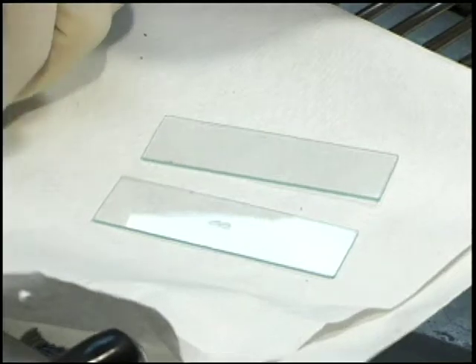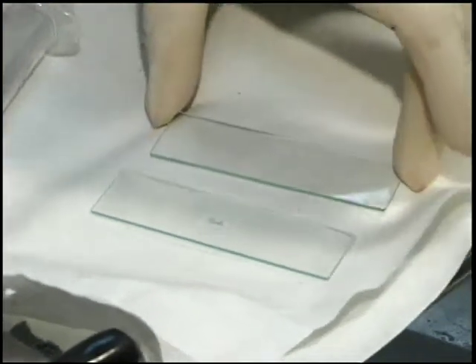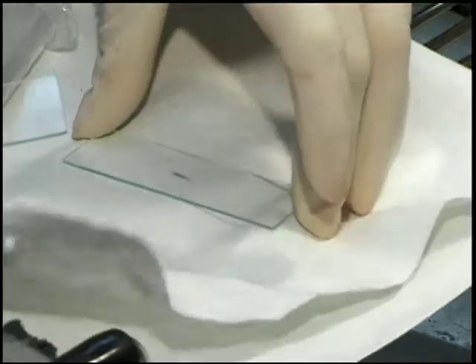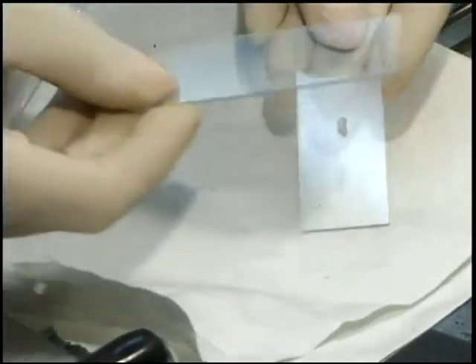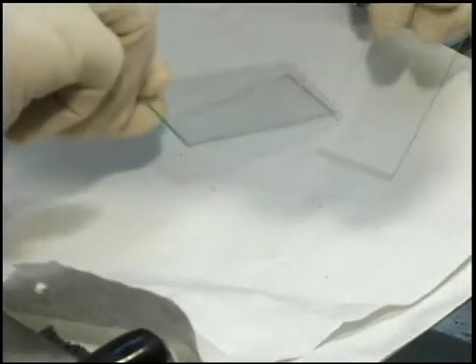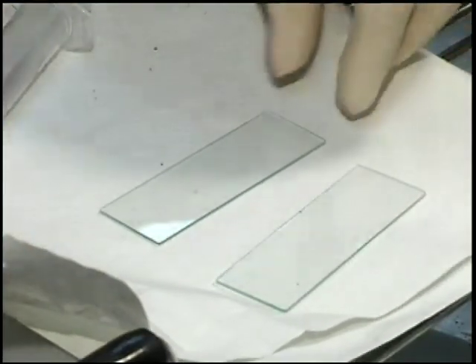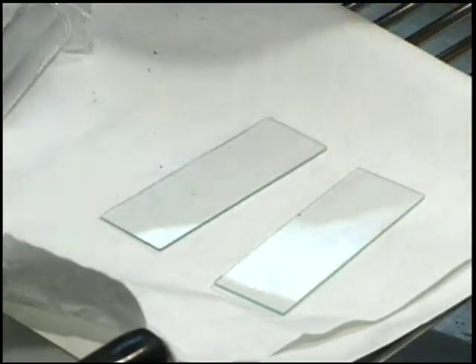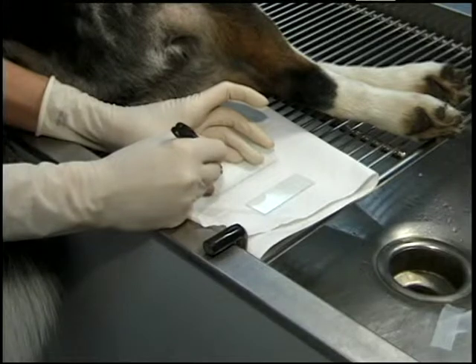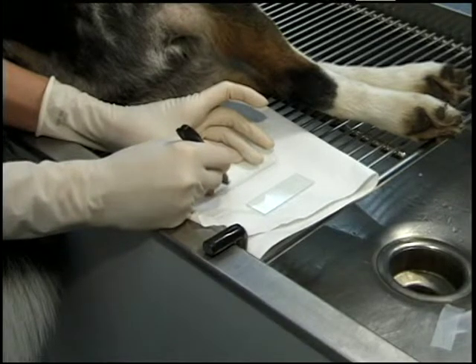If any fluid or tissue is deposited onto the glass slide, it can be equally spread out by doing a pull smear. This is accomplished by placing a second clean slide on top of the sample and sliding them apart as demonstrated here. Both slides now can be further prepared for analysis. Proper labeling with a wax pencil or non-erasable marker should not be overlooked.